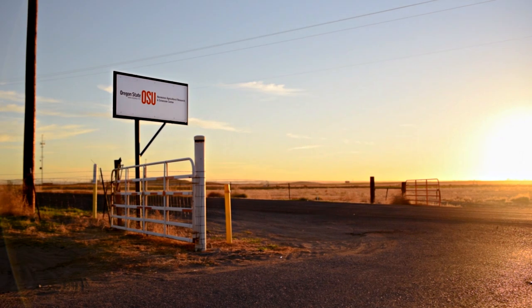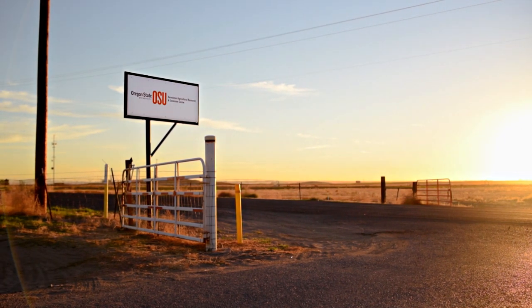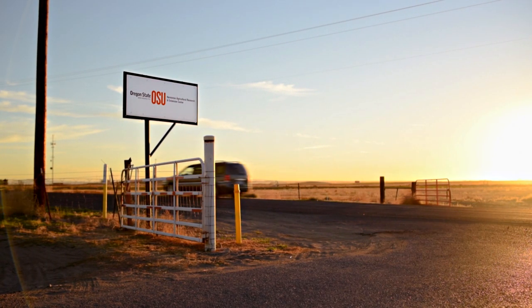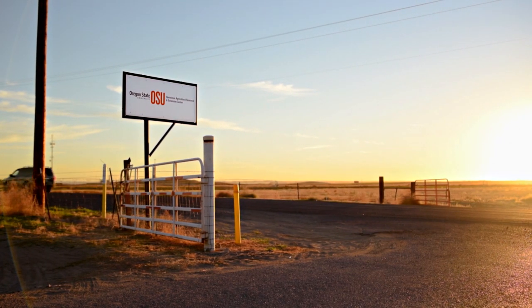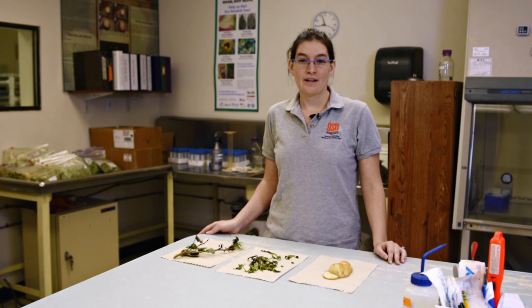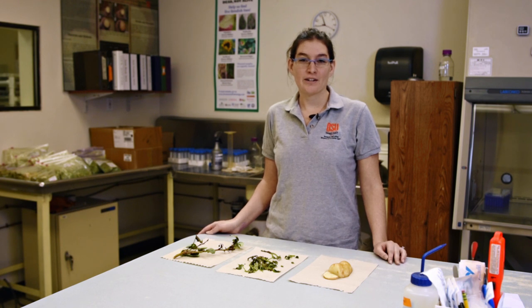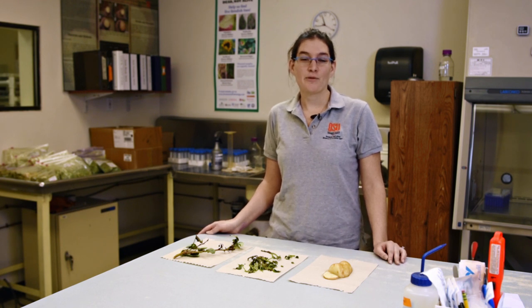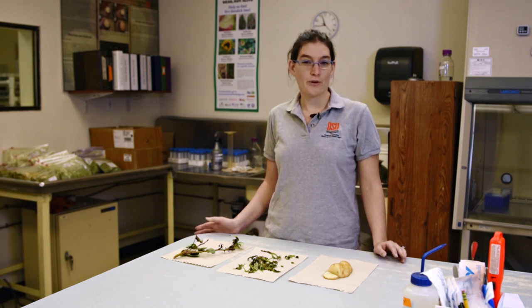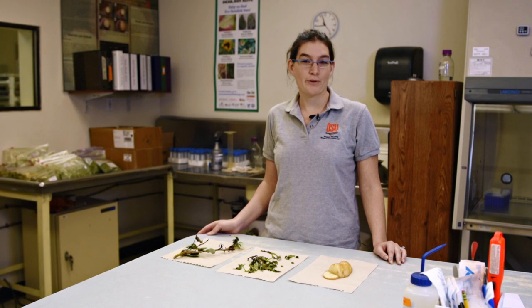Welcome to the Plant Pathology Diagnostic Lab here at the Hermiston Agricultural Research and Extension Center. I'm Cassandra Sago, a lab tech here, and I will be taking you through all the steps that our samples go through after they come in through the door.